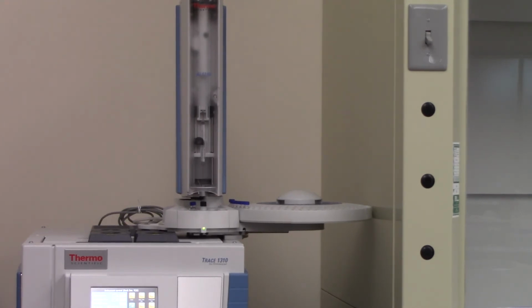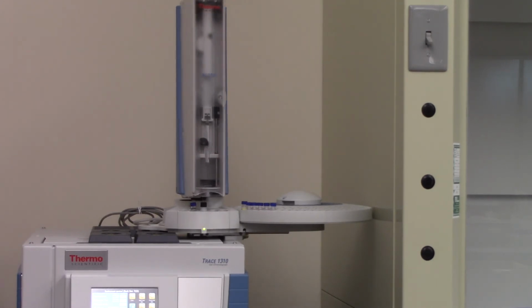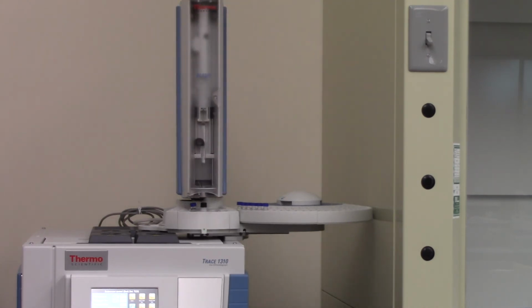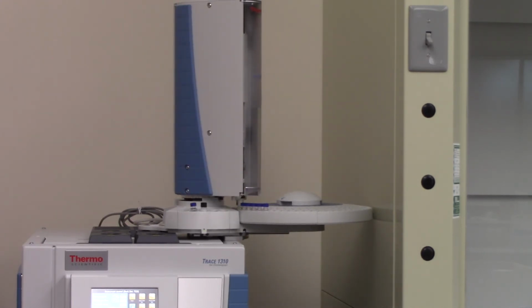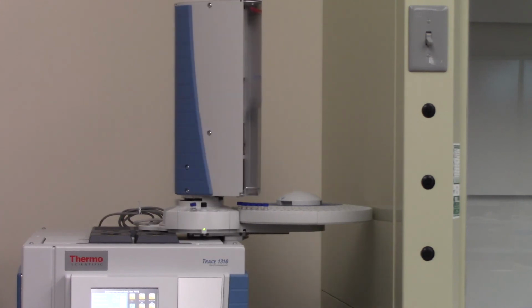And you can see the auto sampler start moving there. And again, it needs to locate itself and the first vial that we put in there in position number 1. And the needle is going in there, picking up the first sample. And we always need to rinse the needle a couple of times. So you see the robotic arm going back and forth and taking some more sample from the vial, and after the rinse, dump it into a waste container. And they will do that a couple of times before it actually does the injection.